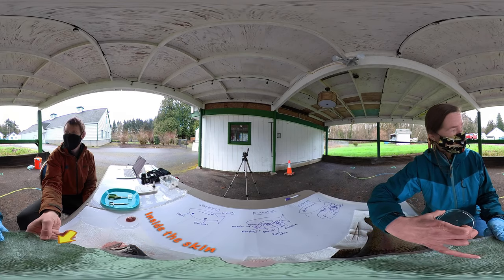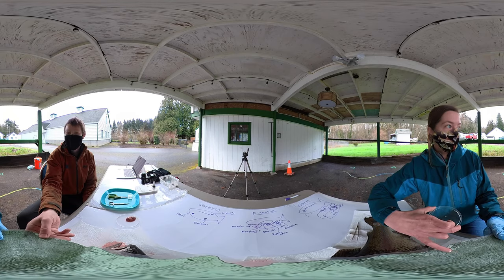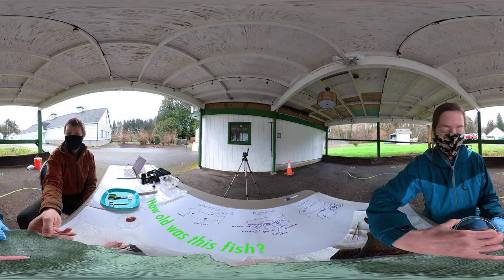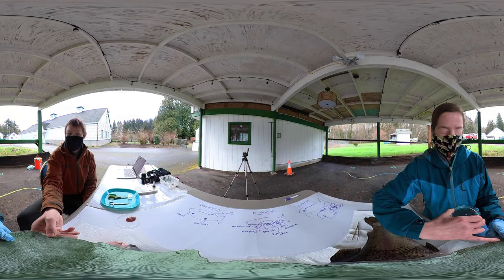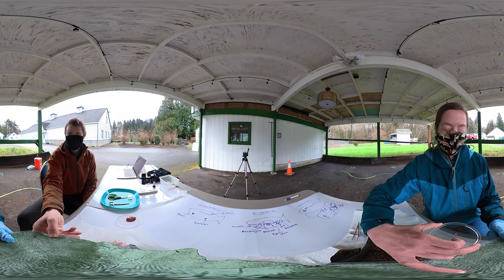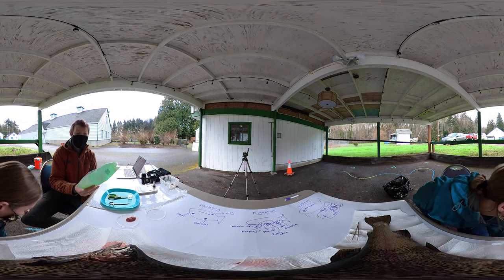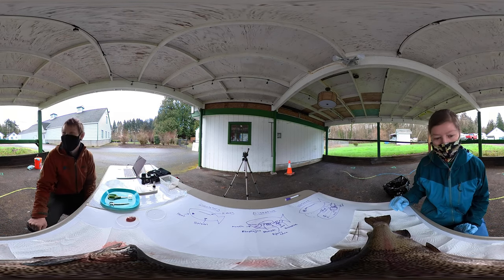This part kind of reminds me of growth rings on a tree stump. Some of you may have counted the rings on a tree stump to tell how old the tree is — or how old it was when it got cut down. You can do the same thing with fish scales. So that's why I was sending these off to a scientist in a lab — they would count how many growth bands. There are rings on this photo that are kind of close together and look darker, and that's when they didn't have a lot of energy in the ocean or in the lake during winter. We can count how many of those bands there are and then age the fish. We can also know if the salmon was in the river or in the ocean at that time. So the scales have an armor and a library of information on their skin and fingernails.